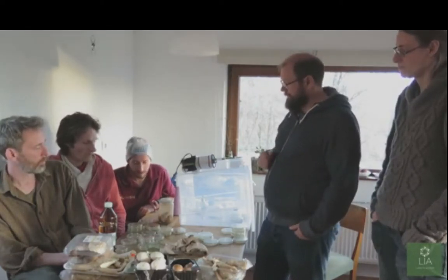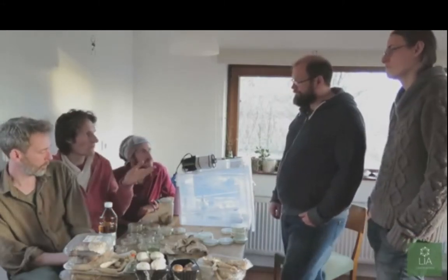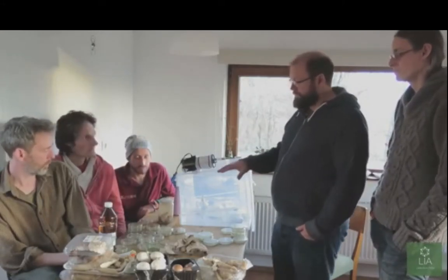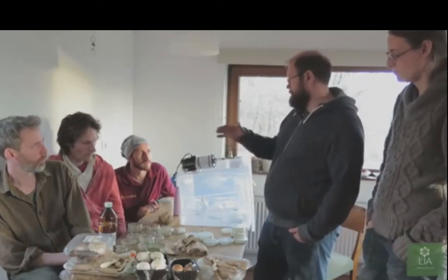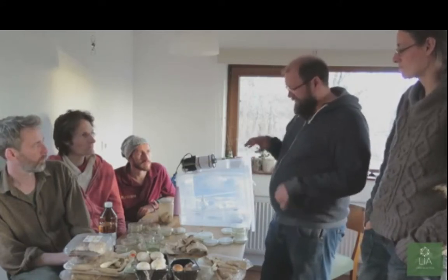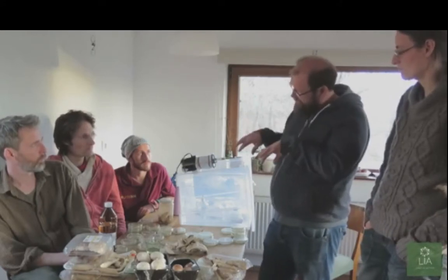Okay. So after 48 hours you would see some growth, and then how long before you could transfer it? A week and a half, something like this. Right, okay. Depending on the growth speed of the various mycelium, different mushrooms will have different growth rates. It'll take 48 hours before you start seeing it. It will start coming out like very furry tentacles outside of the mycelium.